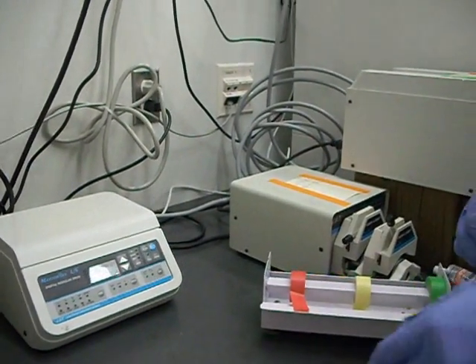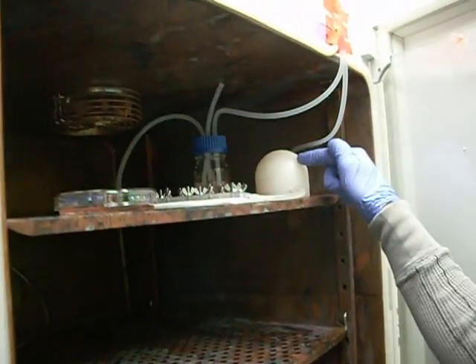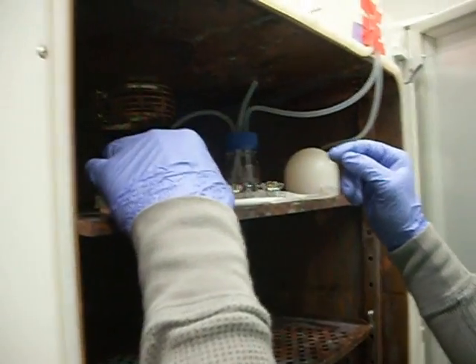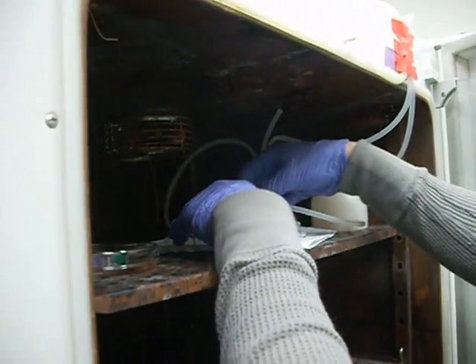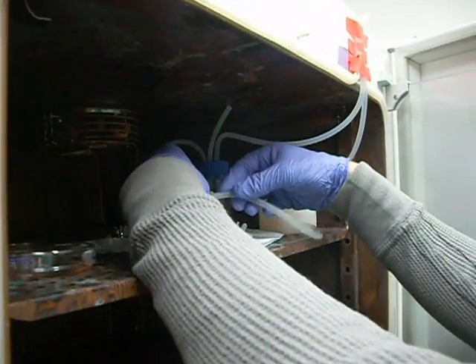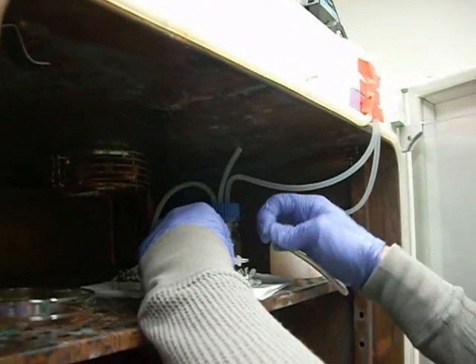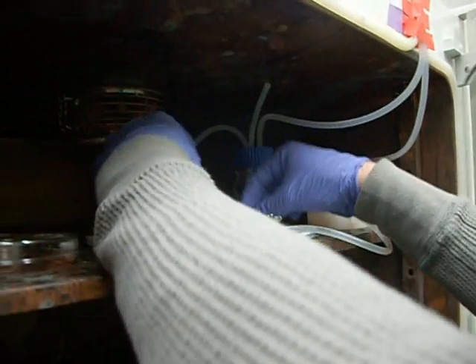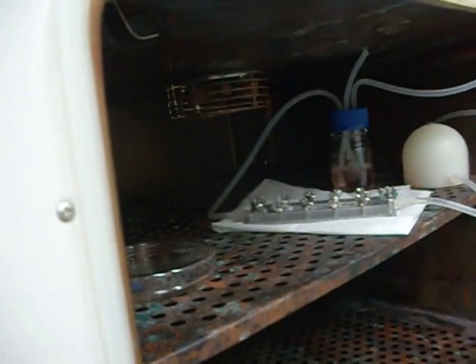Okay, ready? Go ahead and turn off the pump. When you turn off the pump there's still going to be some fluid movement because the air is compressed in here so you'll just have to wait a little while. Because you don't want any fluid moving. Make sure you have no air bubbles in your tubing here. And when you take this apart go ahead and pinch the tubing so the fluid remains right there at the end of the tubing and add it to the flow chamber on the inlet and then add it on the exit on the outlet.